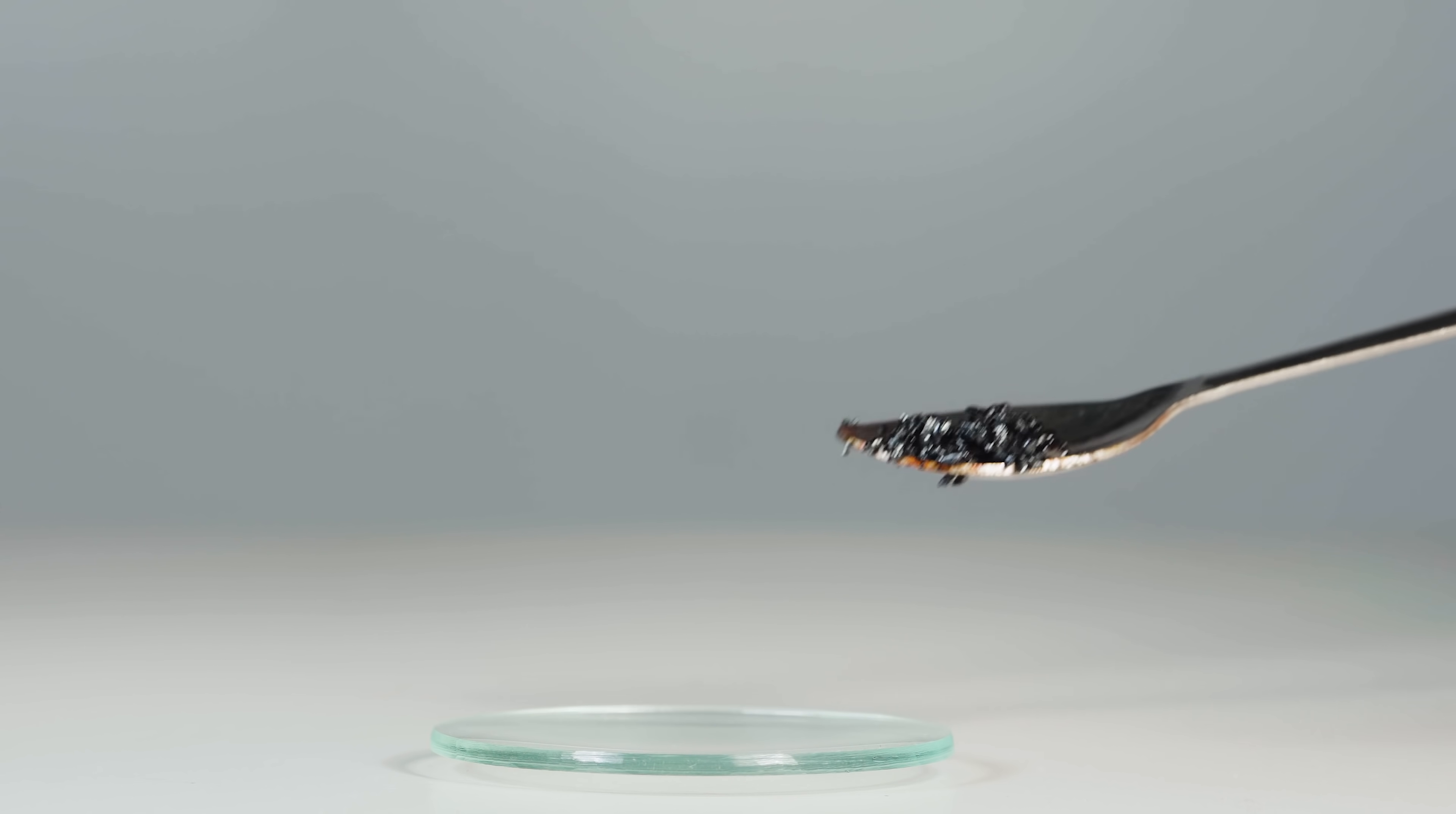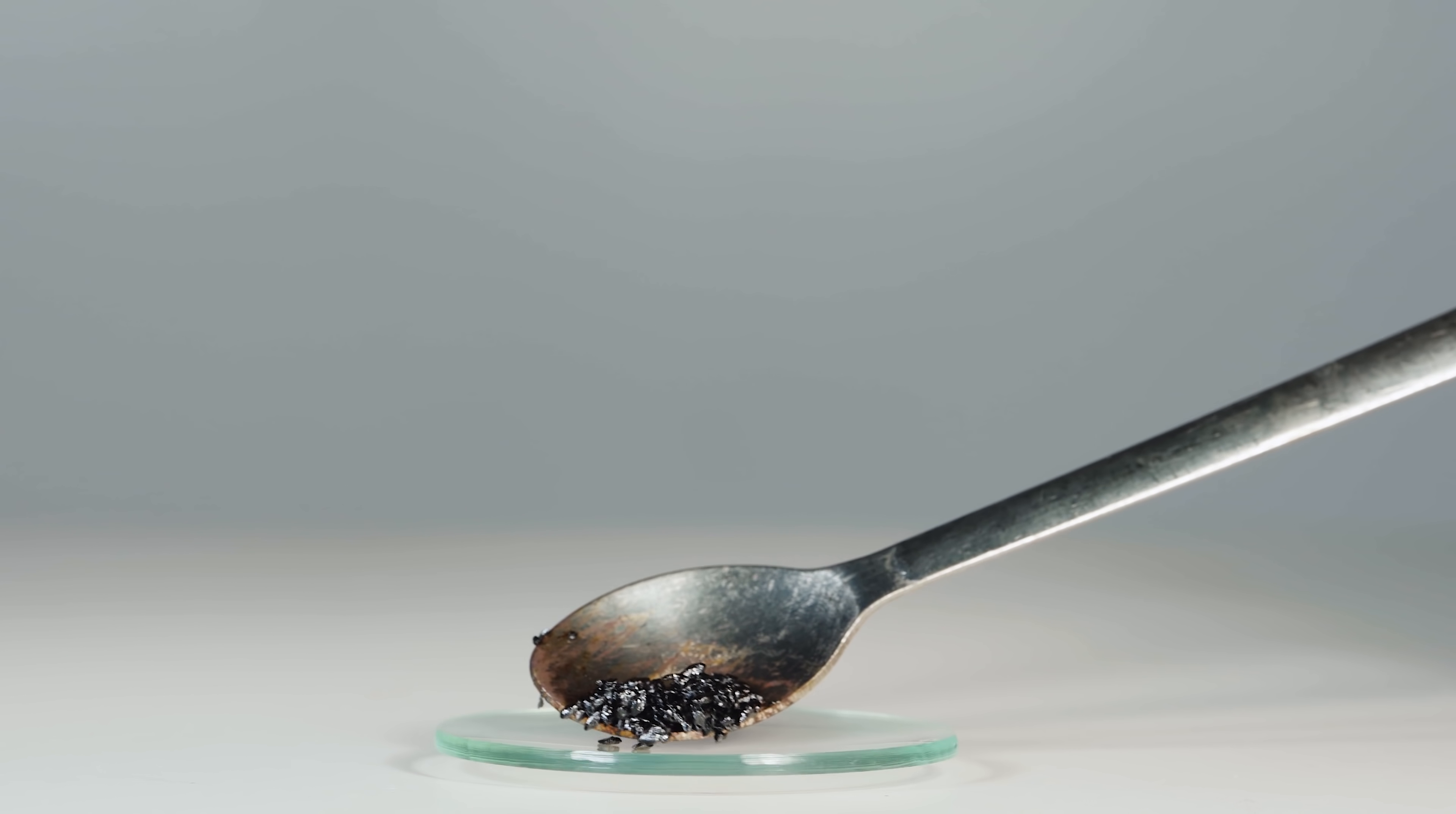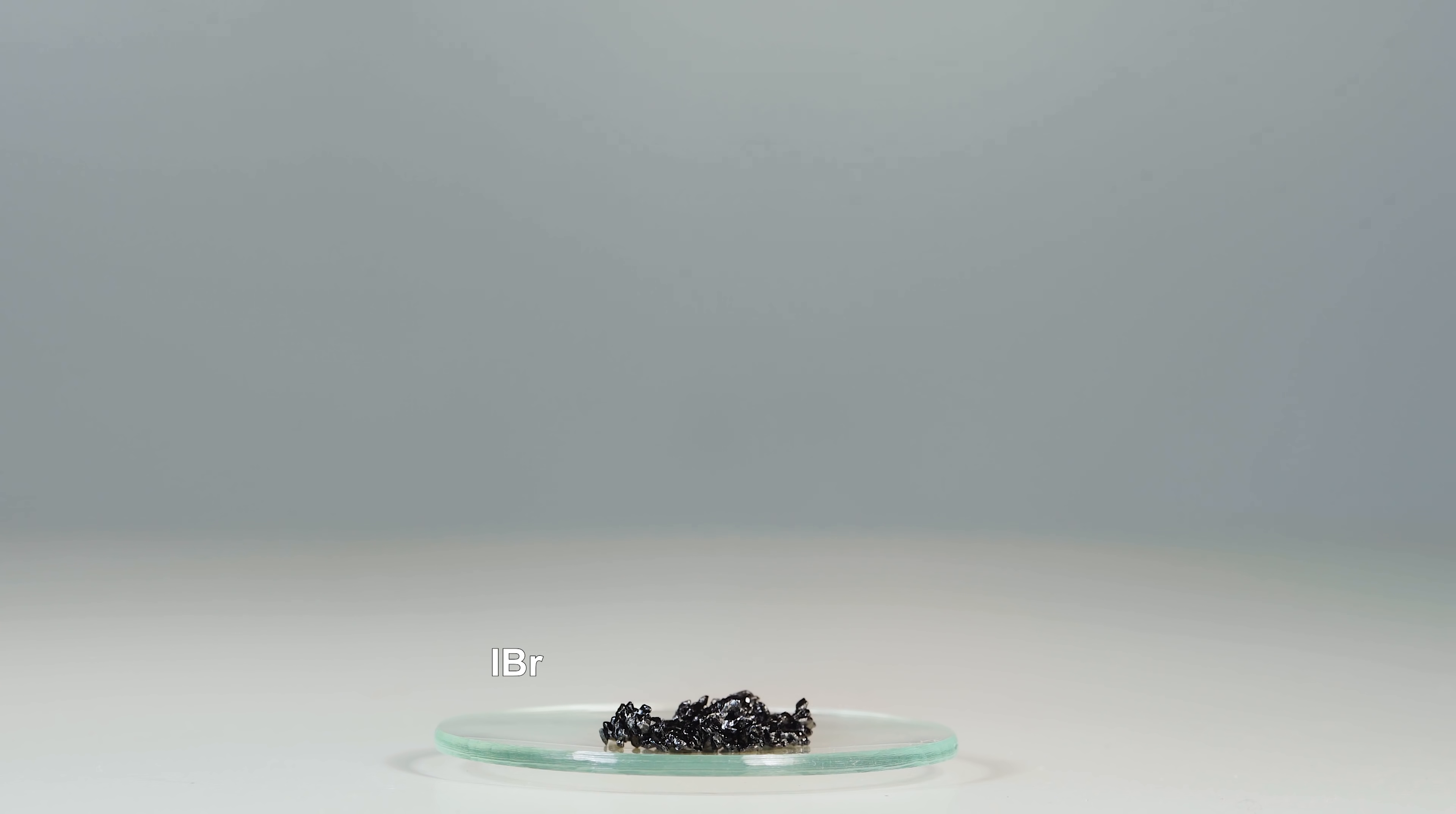Hydrazine hydrate very actively reduces iodine bromide to elemental iodine, hence the vast amount of purple smoke that we can see here.